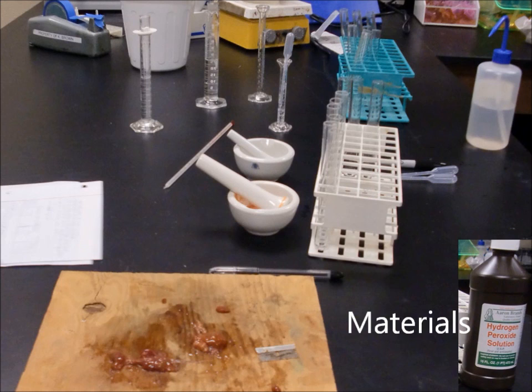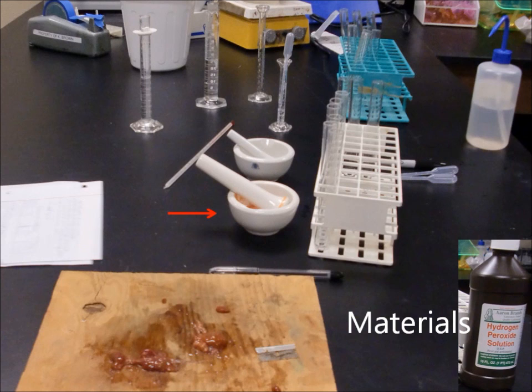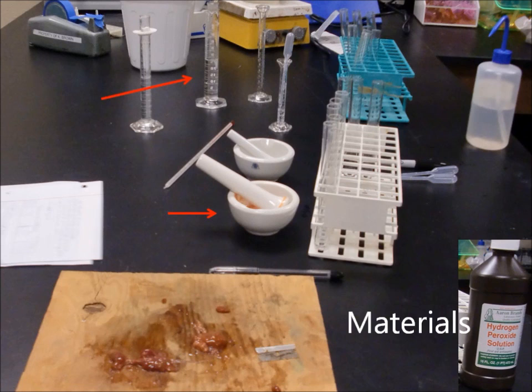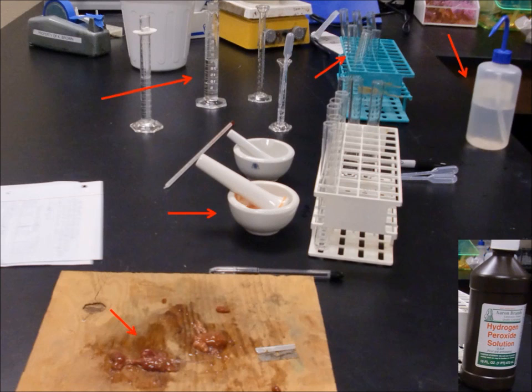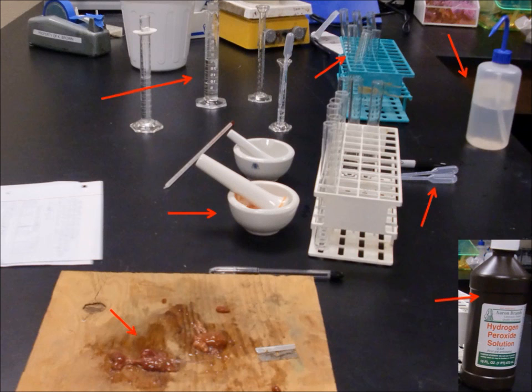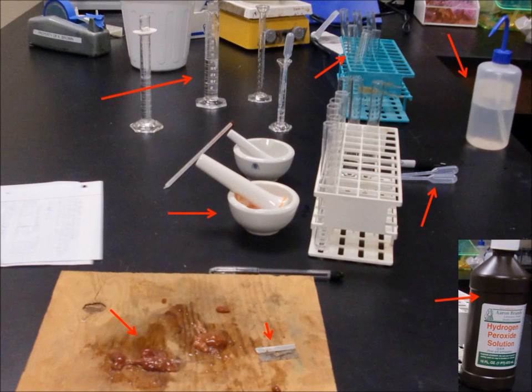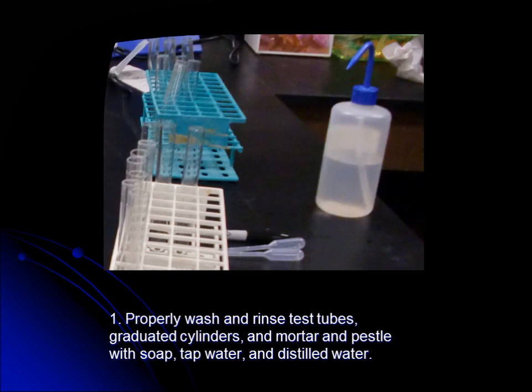Materials for this lab include: mortar and pestle, graduated cylinder, distilled water, test tubes, chicken liver, transfer pipettes, hydrogen peroxide, razor blade, and cutting board.